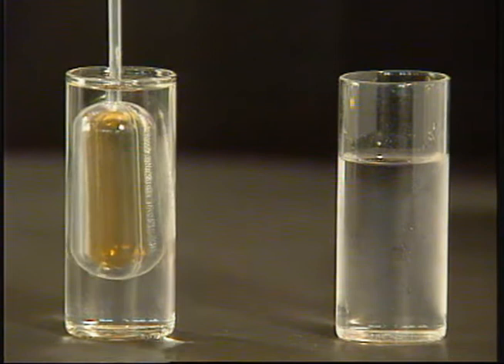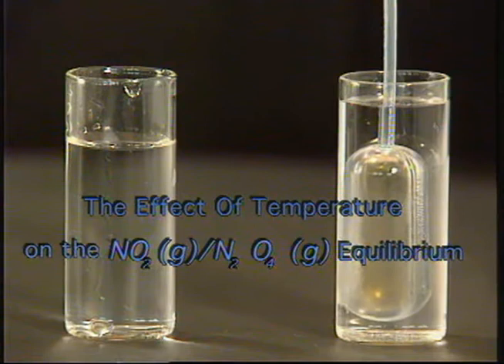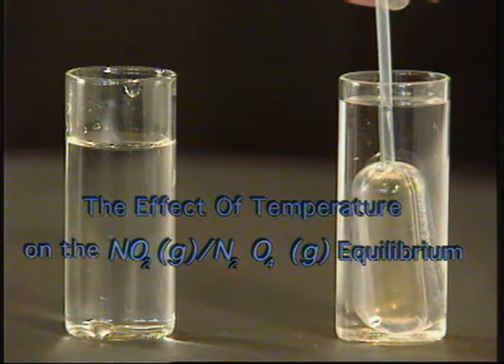Remove the propette from the hot water and immerse the bulb of the propette in the cold water for about 15 to 30 seconds. The effect of temperature on the gas equilibrium between nitrogen dioxide and dinitrogen tetroxide is then investigated by immersing the propette into hot and cold water respectively.